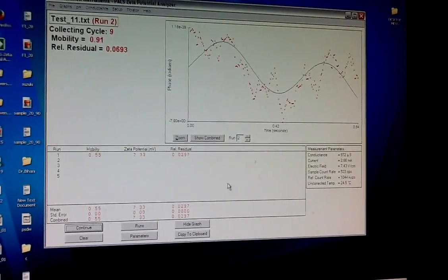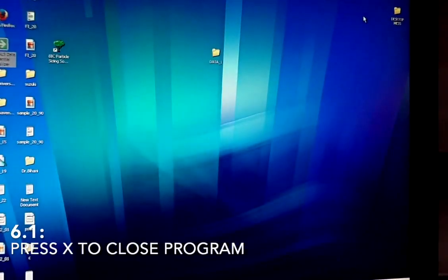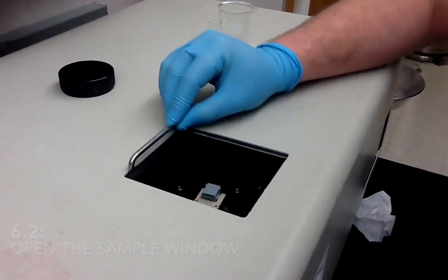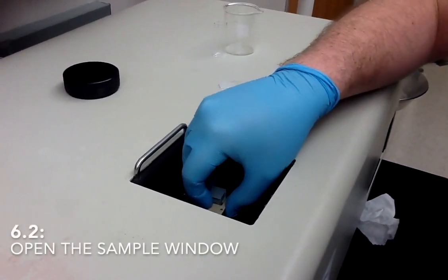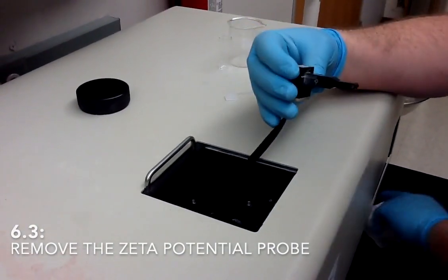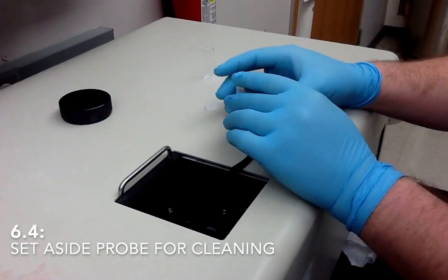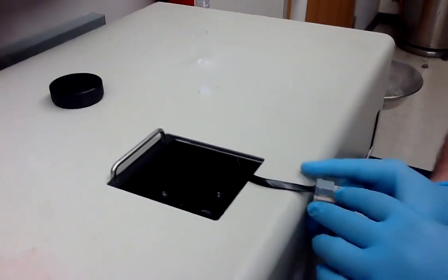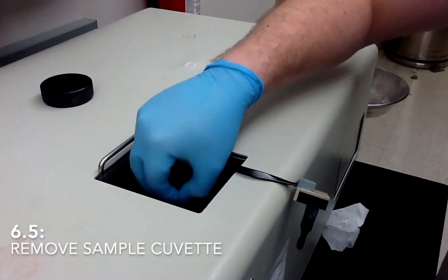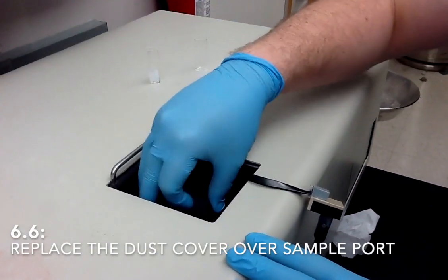Once you're done running your samples, to close the program, you can simply press the X in the top corner. To clean up your sample, you'll open the sample cell again, then you will pull out the sample. The probe will come out first. You will need to set that aside to be washed. And then you can pull out your sample cuvette and reinsert the dust cover.